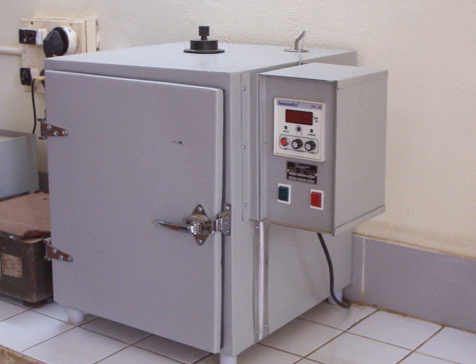An incubator is a device used to grow and maintain microbiological cultures or cell cultures. The incubator maintains optimal temperature, humidity, and other conditions such as the CO2 and oxygen content of the atmosphere inside. Incubators are essential for a lot of experimental work in cell biology, microbiology, and molecular biology, and are used to culture both bacterial as well as eukaryotic cells.